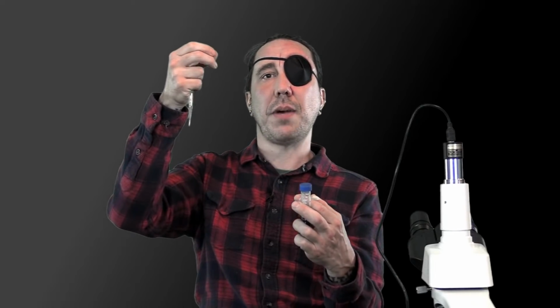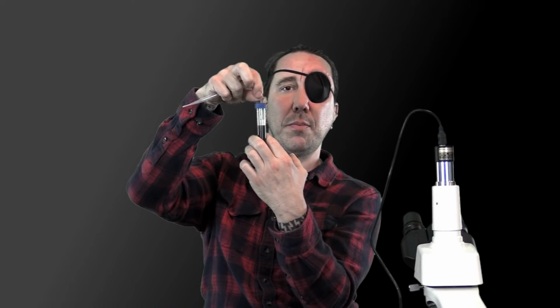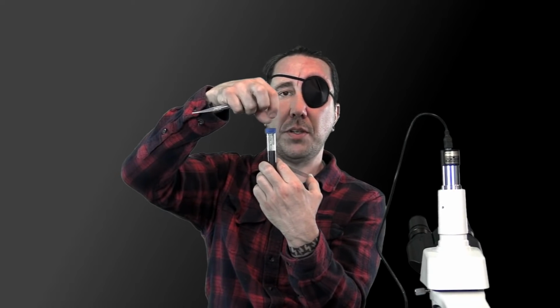And usually when I'm putting my compost in there, if you've got chunks, you don't want to just be tossing chunks in there. I'll grab little bits and crumble them up as I'm dumping it into the water. If you pretend the cap was off, I'll crumble those into there like that. I'm trying to break up any aggregates, any clumps, so that we're getting as much surface area exposed as possible in the water to pull off.